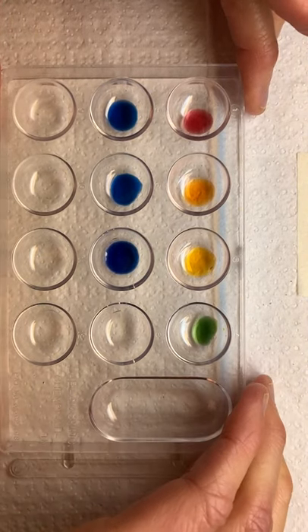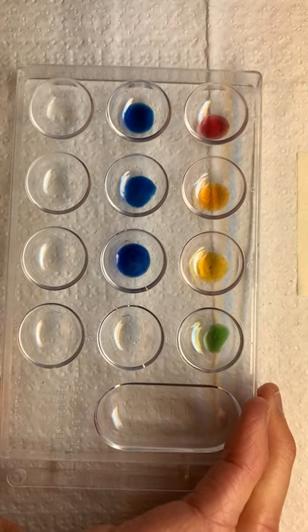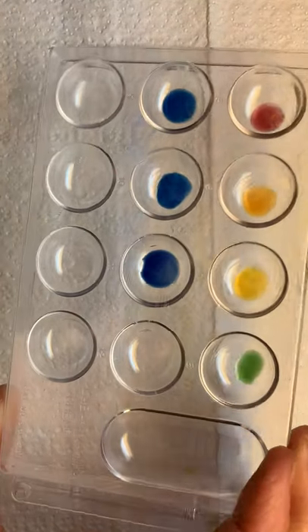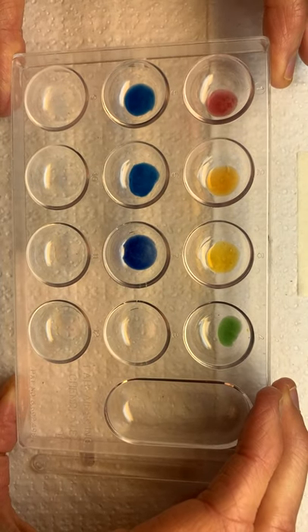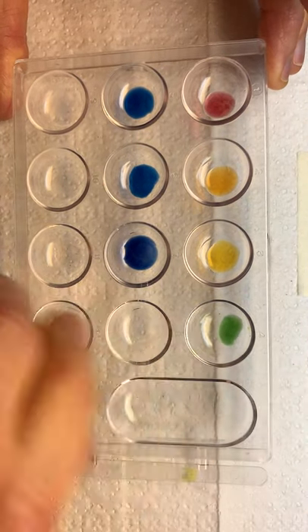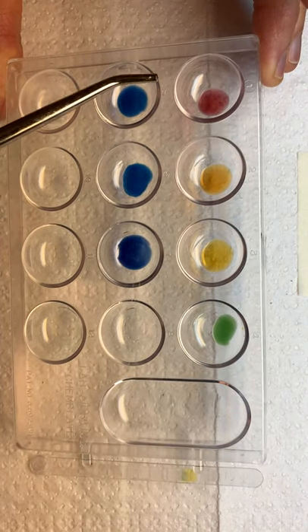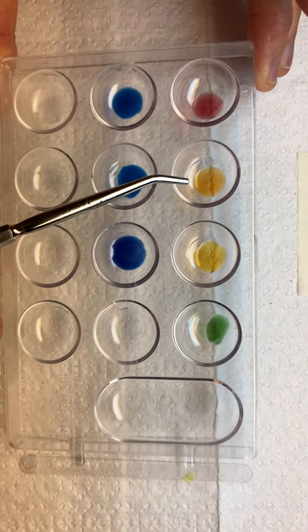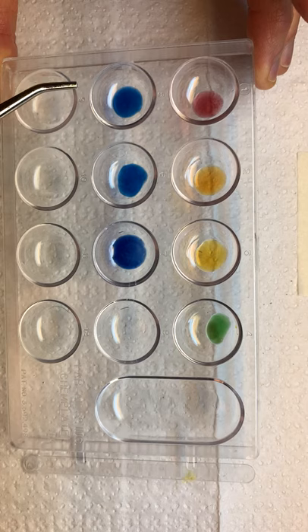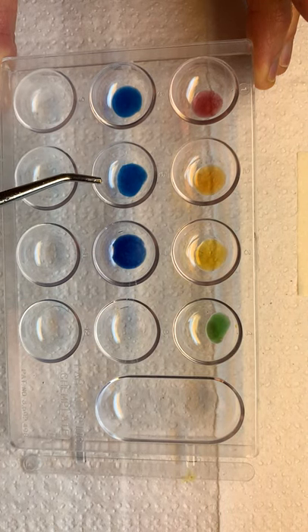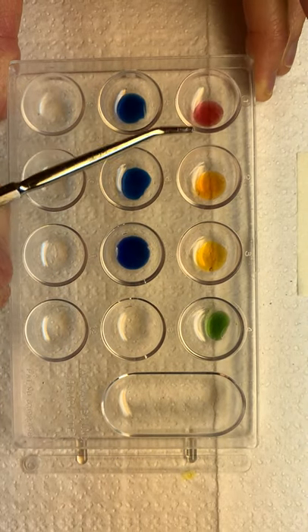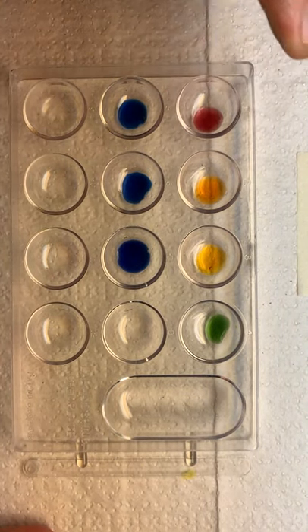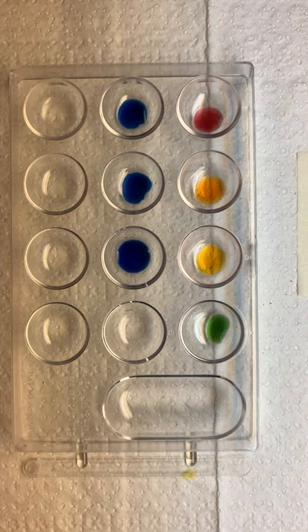And note, it might be a little hard to see with this lighting. You're looking at the differences in these shades. And so we've got a pink red and an orange and a yellow, a green, a blue, and we're actually moving towards indigo and violet. So just think, this is our Roy G Biv.